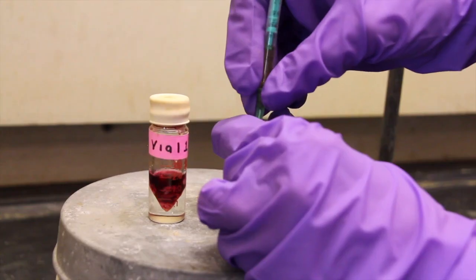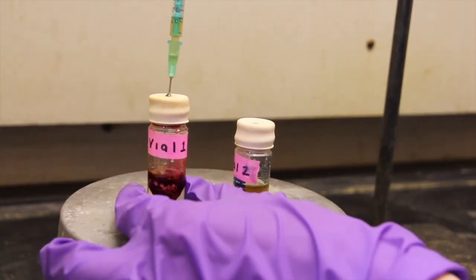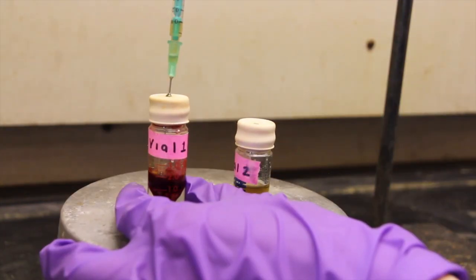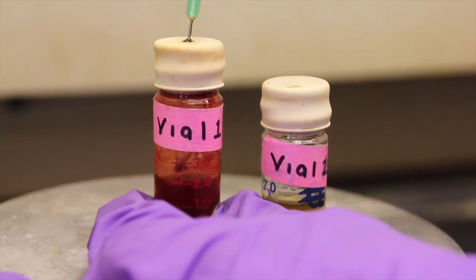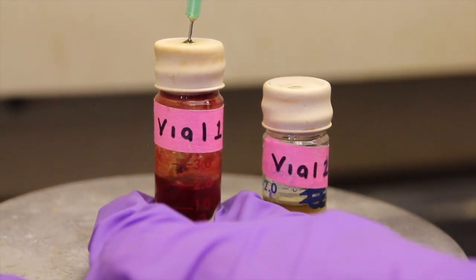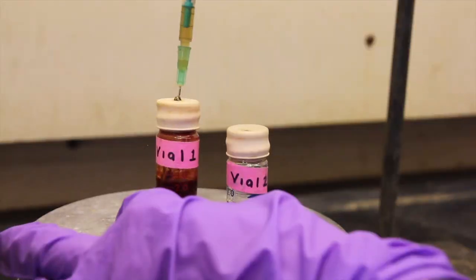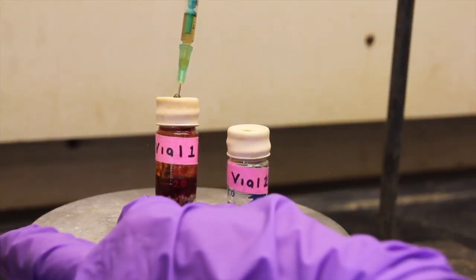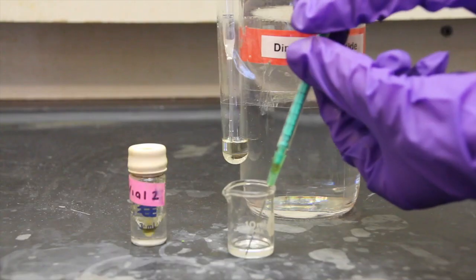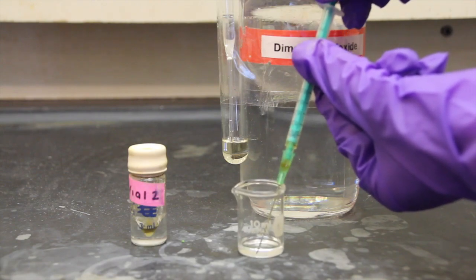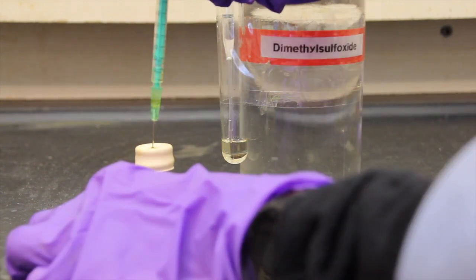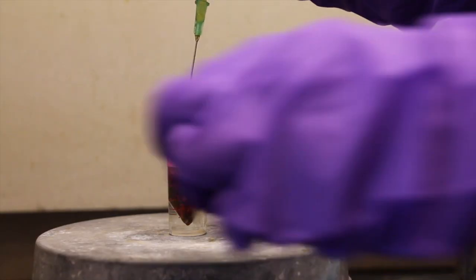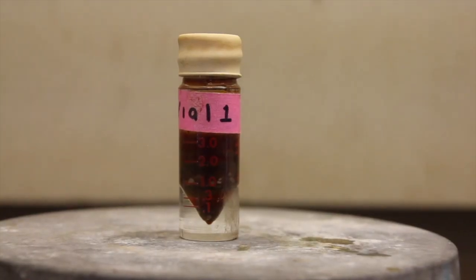Using a syringe, obtain 0.25 milliliters of the iron chloride solution from vial 2 and add it to the reaction mixture in vial 1. At this point, all iron 2 chloride should be dissolved. Continue adding the solution from vial 2 in 0.25 milliliter portions over a 10 minute period, stirring the vial continuously. After all of the iron 2 chloride solution has been added, rinse vial 2 with 0.25 milliliters of dimethyl sulfoxide and add this to the reaction vial. Continue to stir the vial for 15 minutes and allow the reaction to come to completion.